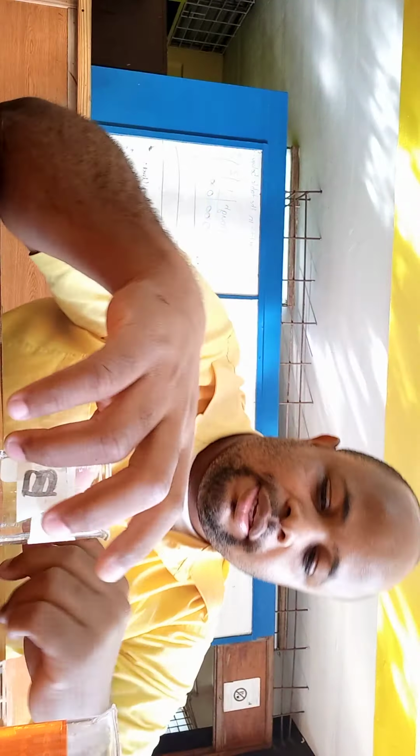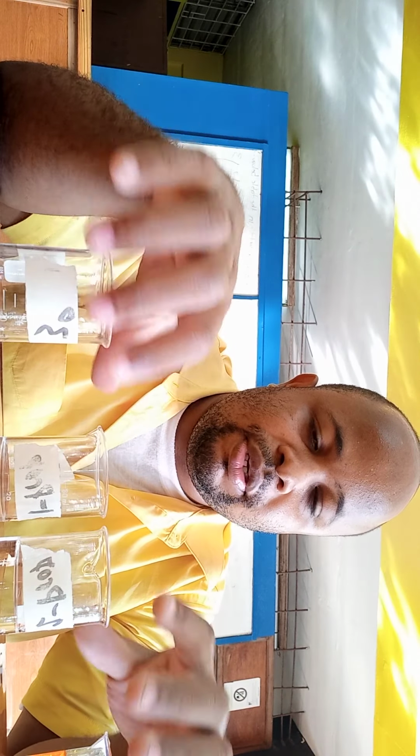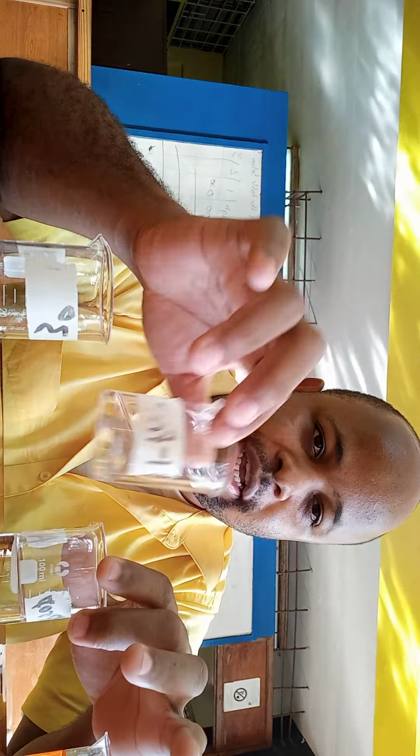Now, as you can see, alcohol A is 2-propanol and alcohol C is 1-propanol. Alright? This one is tertiary butyl alcohol, a tertiary alcohol. So you can see that both the primary and the secondary alcohols are oxidized, but the tertiary one is not.